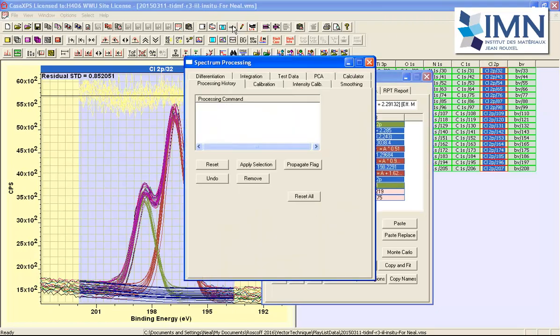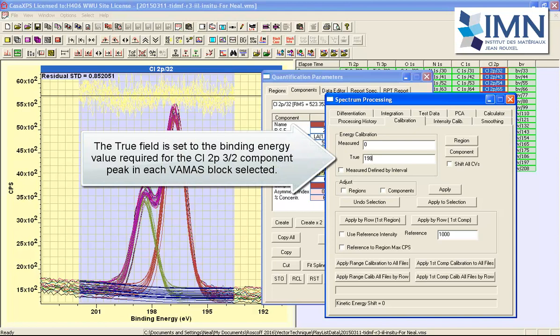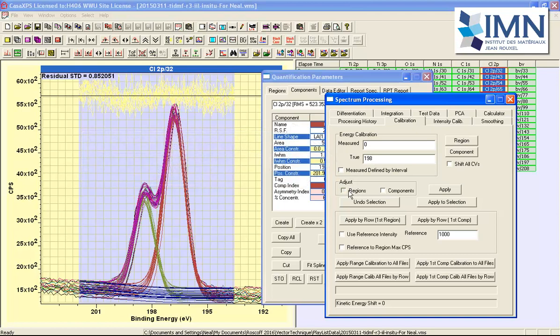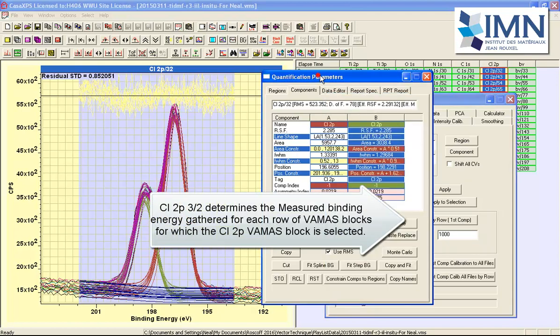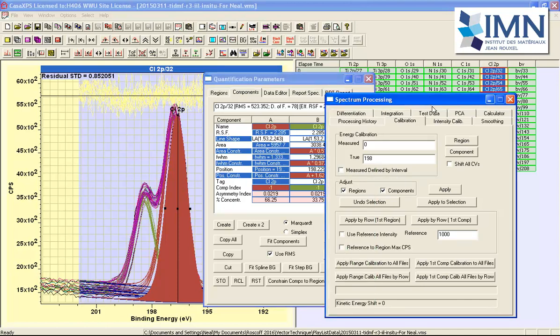So to calibrate the full file, what we need to do is bring up the spectrum processing dialog window, and on the calibration property page we need to enter a true value, and this will be 198 eV, and this corresponds to the binding energy that we expect for the chlorine 2P 3 halves peak, and we'll tick the region and components tick boxes, so these will be shifted when we perform the calibration. And we've got a column selected of the chlorine 2P so that we can now say apply by row first component. So the first component corresponds to the one that we have in the first column, in column A of the components property page, and when I press this button then the measured value will be calculated from this peak position that has been fitted to these data, and then the offset will be applied to the row, and this will be performed each time for each one of these spectra in the rows of this data file.